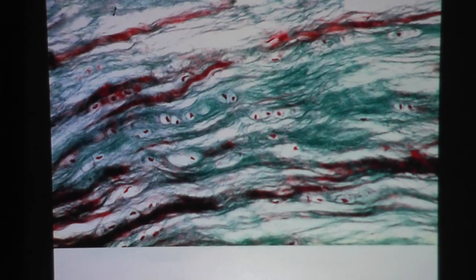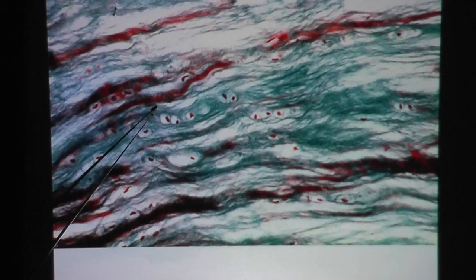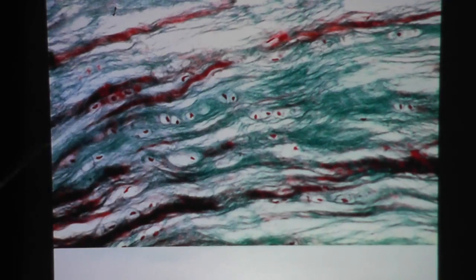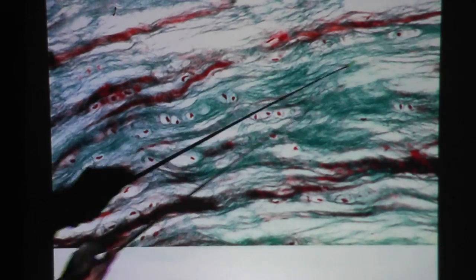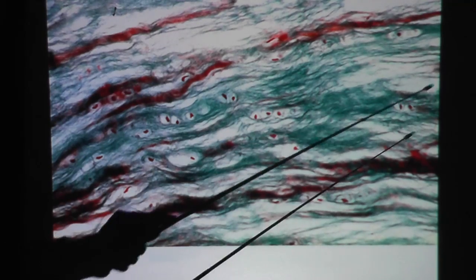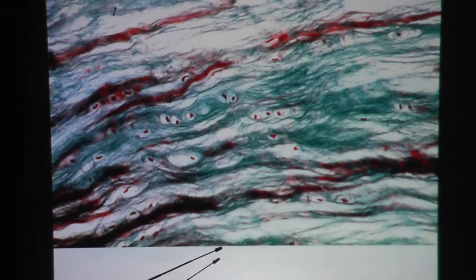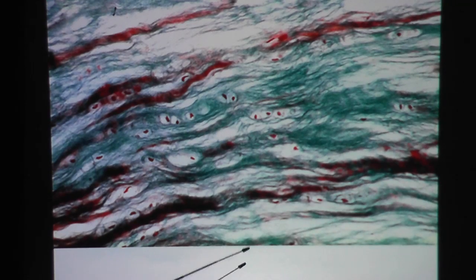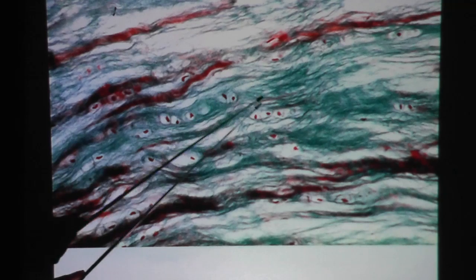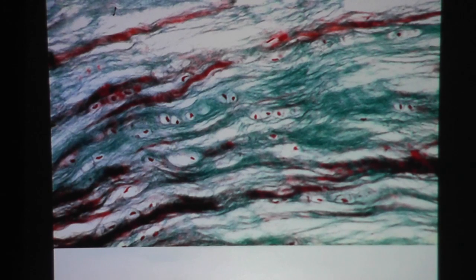One last look. Here we have collagen fibers running in this direction — bands of collagen fibers. And in between these collagen fibers, you see chondrocytes in lacuna. So this is fibrocartilage.